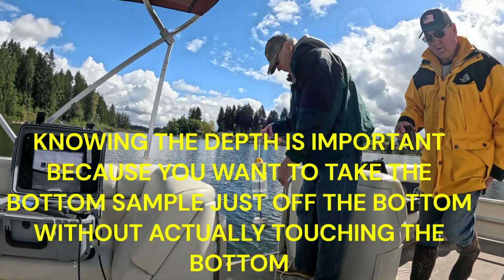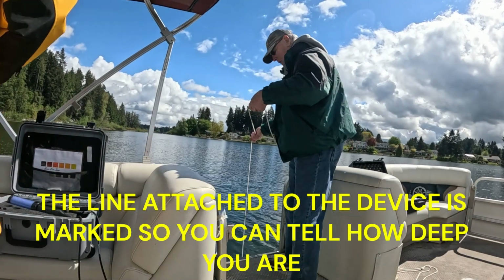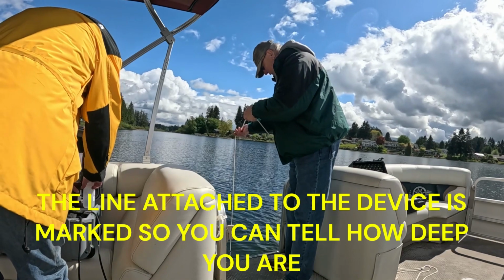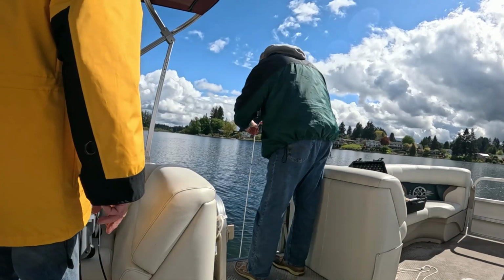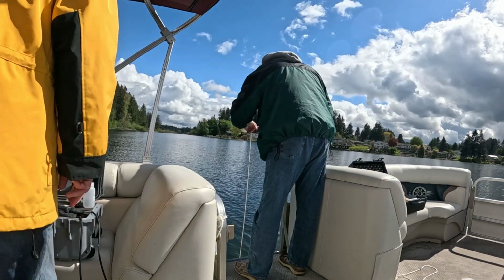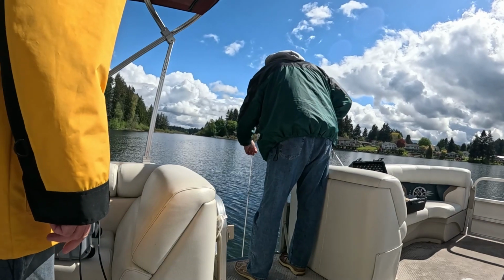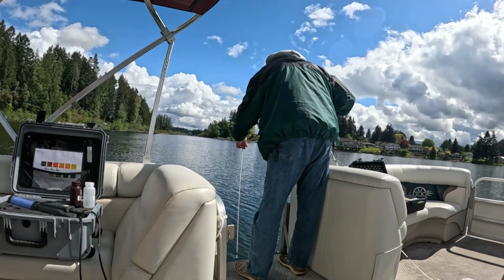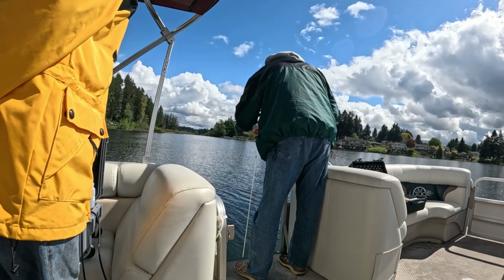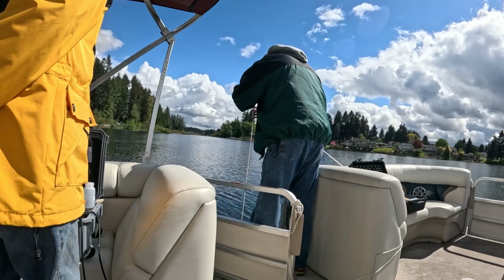And so the depth here is 5.2 meters. It's a little deeper than the other one. Yeah. Well, you were at 14 feet, and now you're at 17 feet. So if you hit 5 meters, you're right about right. 5 meters. Yep. You're just off the bottom right there.